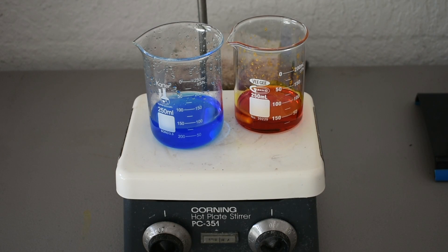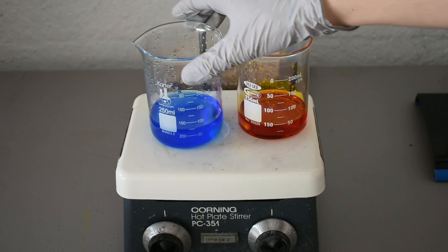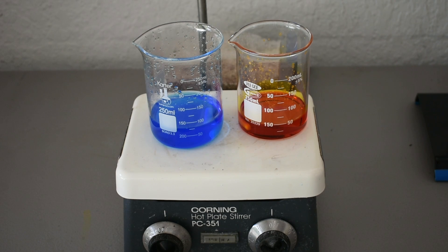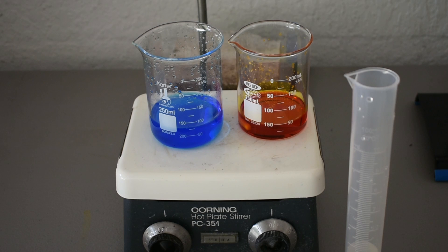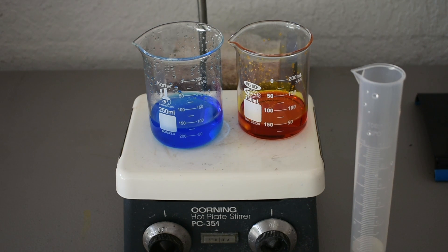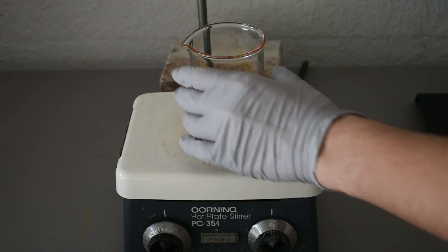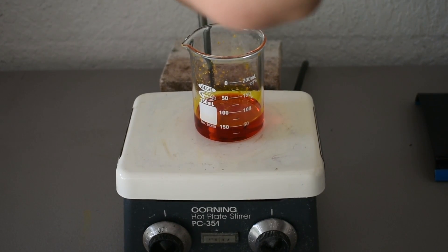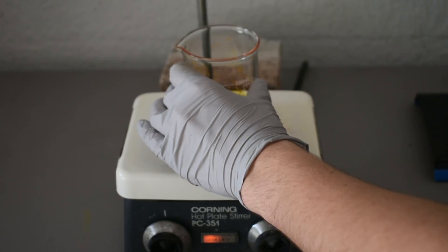Alright, so we have some real nice colorful solutions—a nice orange, kind of a deep, almost red-orange, and a nice light blue solutions here. And the next step is to add 42 milliliters of what's supposed to be a 10% ammonia solution, but since I don't know the concentration of mine, I'm going to put in 42 milliliters anyway. I think it's probably around 5 to 10%, and if everything doesn't react, then I'll just add some more. So I'll add this to the dichromate solution with stirring.